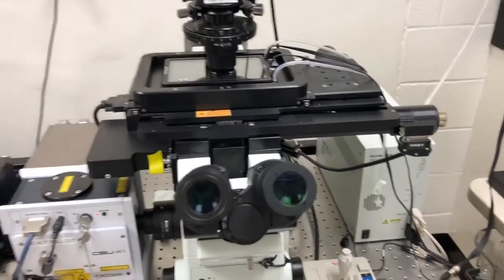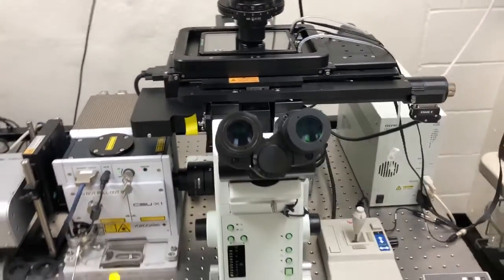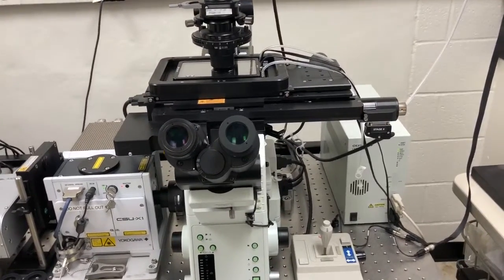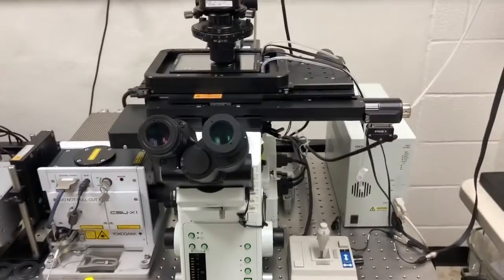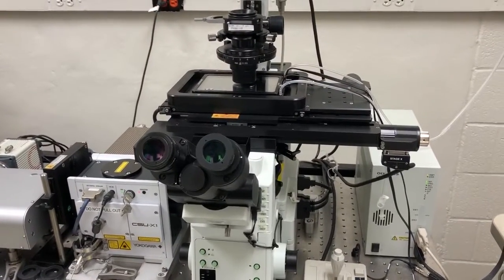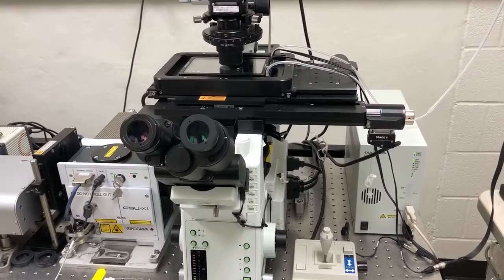What I will discuss now is how to set the microscope up so we can look at things by eye. This microscope has a number of safety features and options that make this process of looking at things by eye a little more tricky.